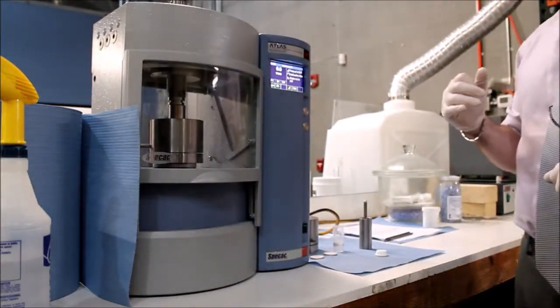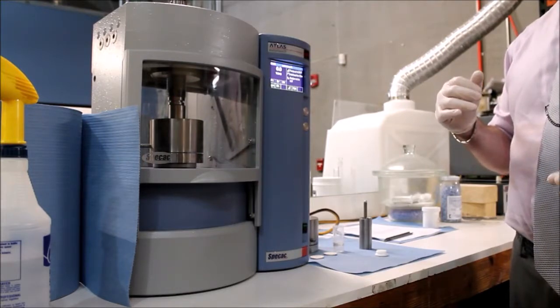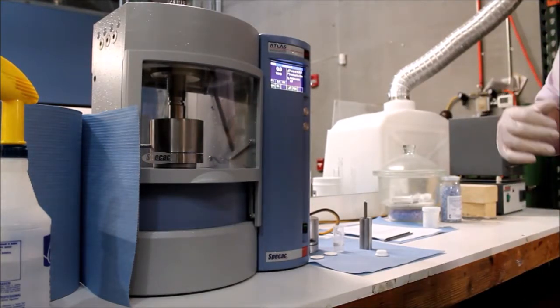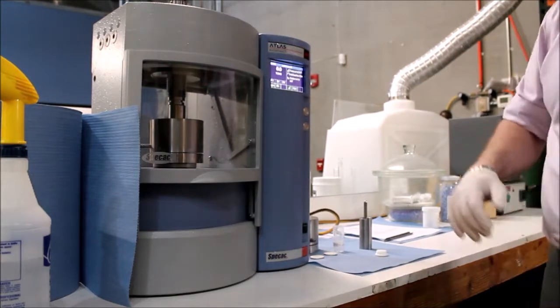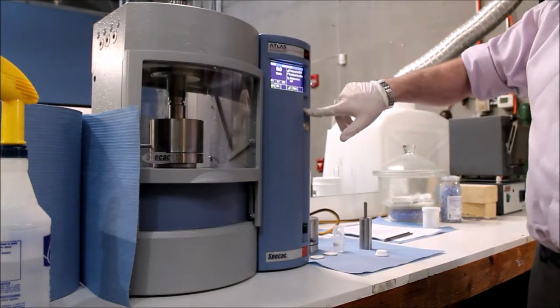Notice the unit senses the guard being opened. Two buttons are located on the right. Press the topmost button to begin the program loaded, while the bottom will stop the unit should it be needed.